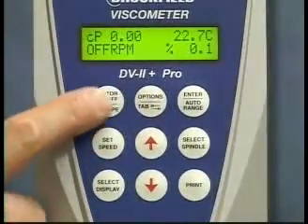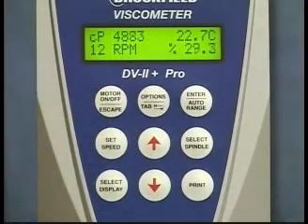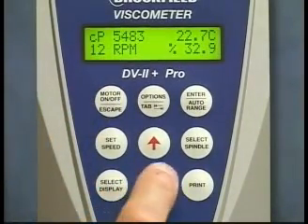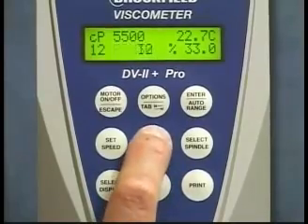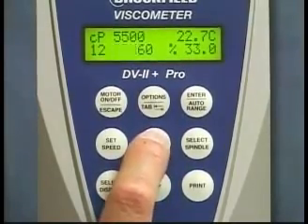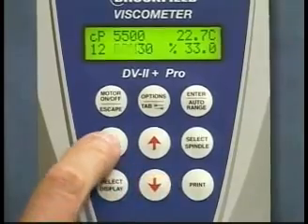You can also change speeds with the motor on. With the motor on, press the up or down arrow keys to choose the appropriate speed, then press the set speed key again and your speed will be entered in the instrument.